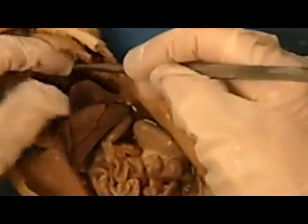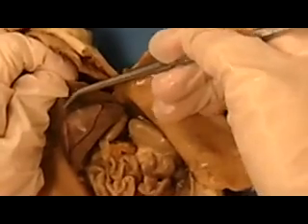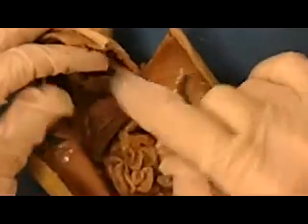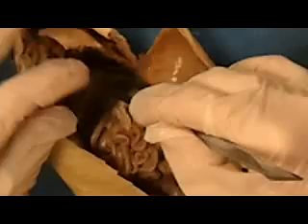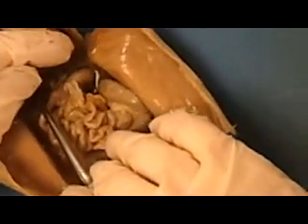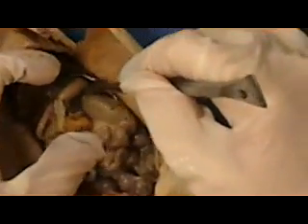Okay, so again we have the diaphragm, the muscular structure that separates your thoracic and your abdominal cavity. Alright, connected to that you'll see this ligament right here, and it's connected to the liver. The liver is just one liver, and it's also lobed, so that's why it looks like this. If the rat had a gallbladder, it would be somewhere in the liver. It's a little green sac. The rat doesn't have a gallbladder, but you're still expected to know it for the human torso and for pictures.